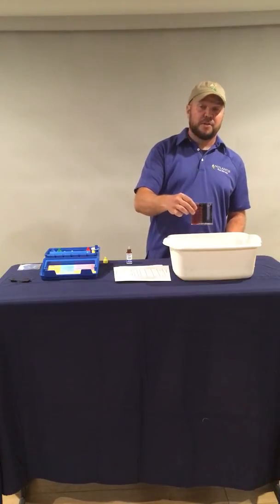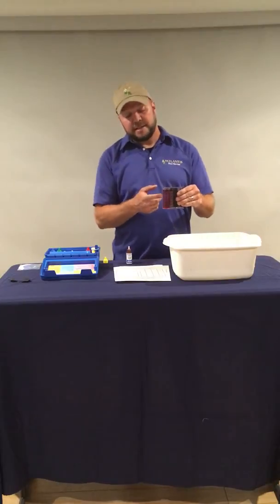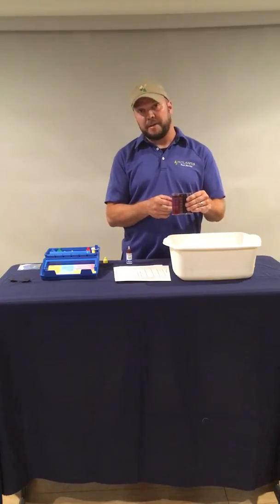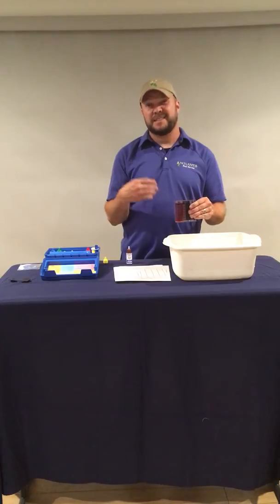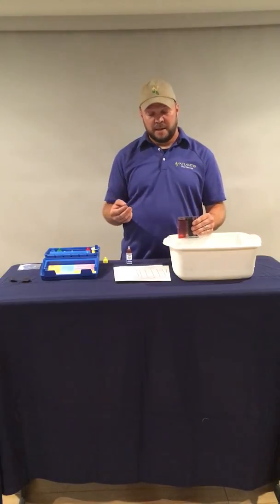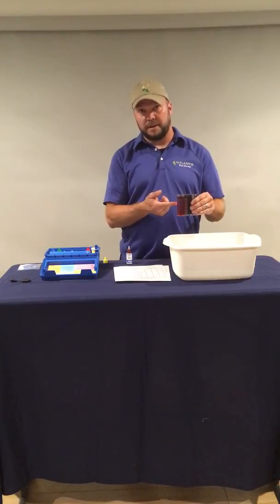All right, so that's 30 drops, and we still haven't changed. So that's an indication that we're way over the acceptable limit. If this was a pool, it would fail because we're beyond that. 30 drops times 0.2 gives us 6 parts per million, which is very high. It's beyond even the range for a hot tub. At this point in time, on your regular pool, if you had tested it, this would have turned clear.